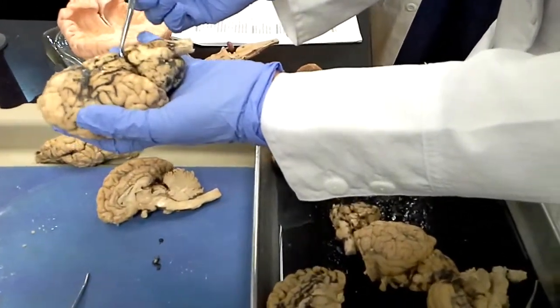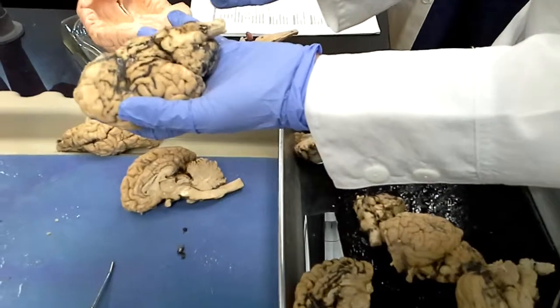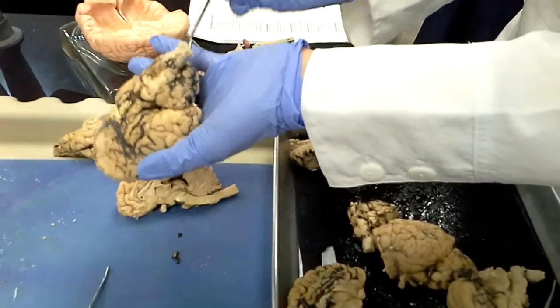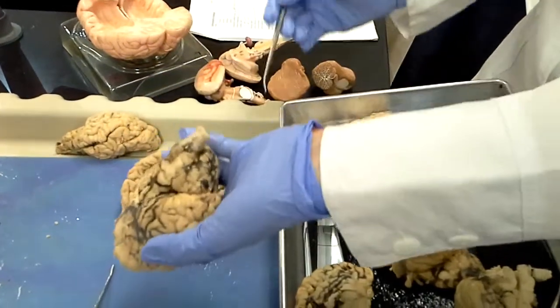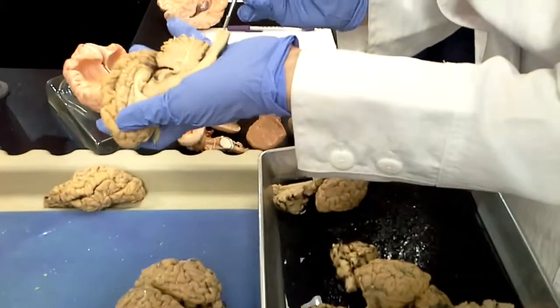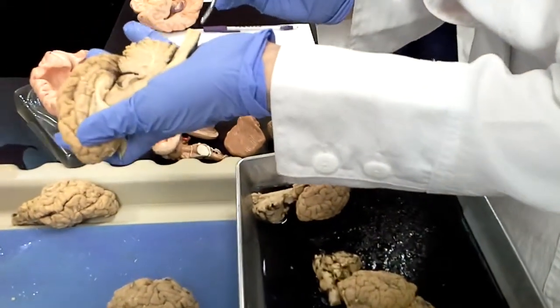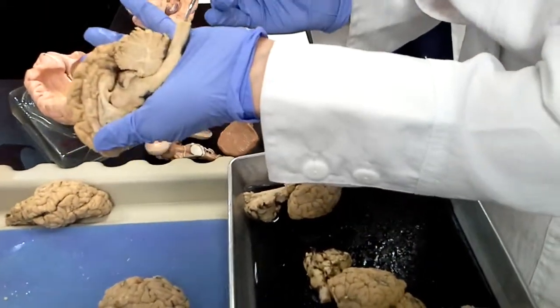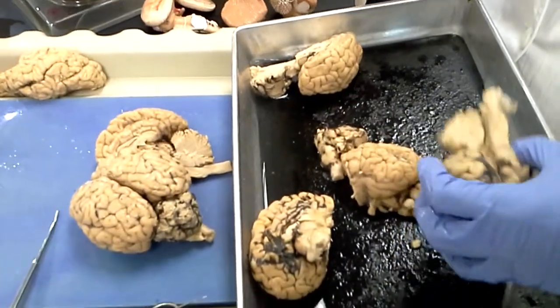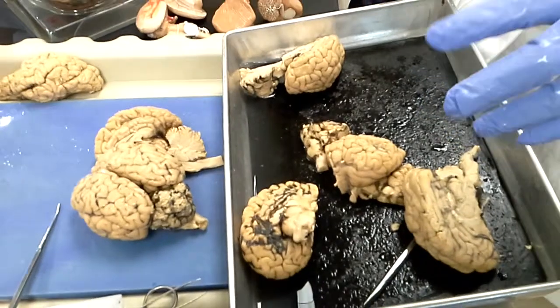All right, so pons, the big prominent bulge, a smaller bulge below it, medulla, and then when it narrows, that becomes the spinal cord. The spinal cord you can see here. Depending on the cut we get, there is a hollow tube running through the spinal cord, and that's the central canal. I'm not sure we have that very well. All right, those are basic parts.